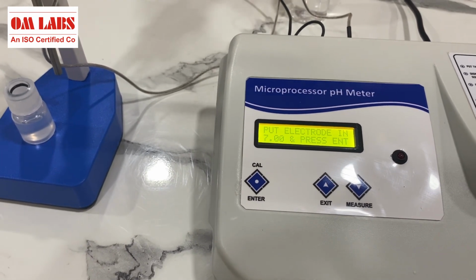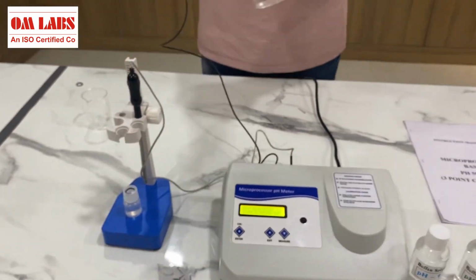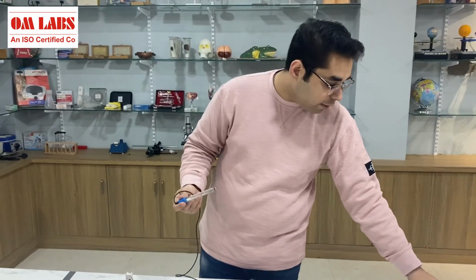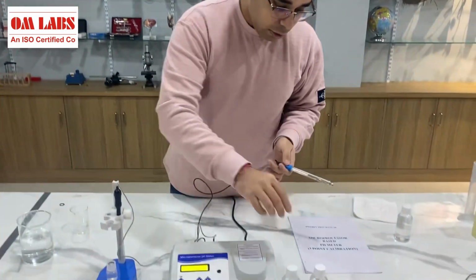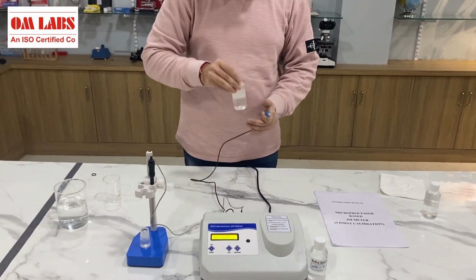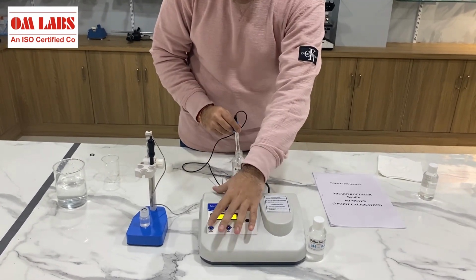Now what I'll do is I'll rinse the probe again. I'll put it aside and I'll take the pH 7 buffer, and later on again with the same procedure I'll proceed and calibrate this particular device with pH 7 buffer. So I open the bottle like this and I'll immerse my electrode into this particular solution, and I'll press enter again.